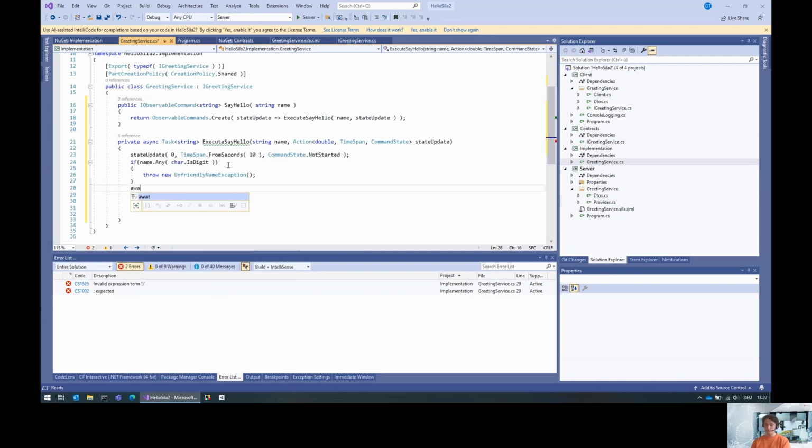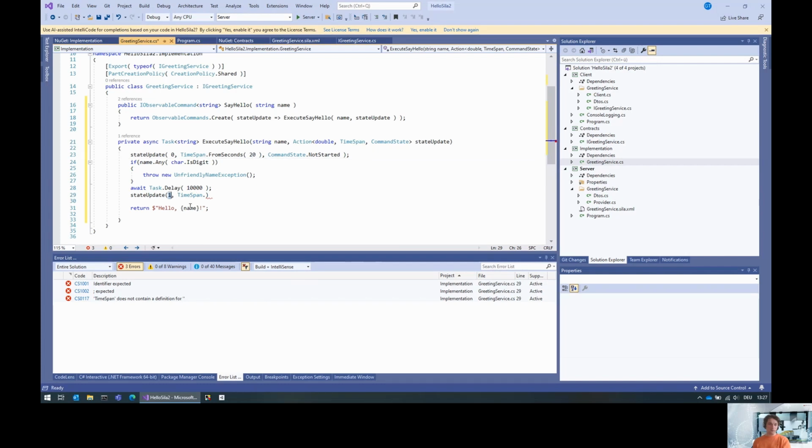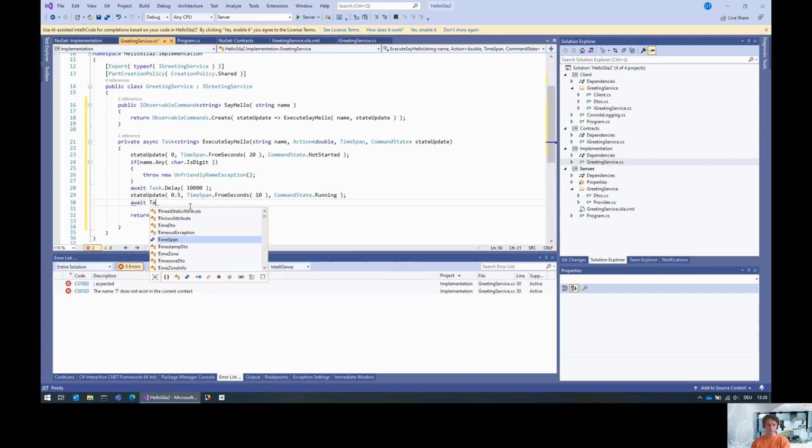No, first, let us do some real work. So put a delay in here for 10 seconds. We said that we would use 10 seconds. And then we have the state update, in which we say, okay, now we are finished. Actually, not, let us take 20 seconds here, then wait for 10 seconds. Then we are halfway done. We say that now we still need 10 seconds, and we are executing. And then wait for another 10 seconds.